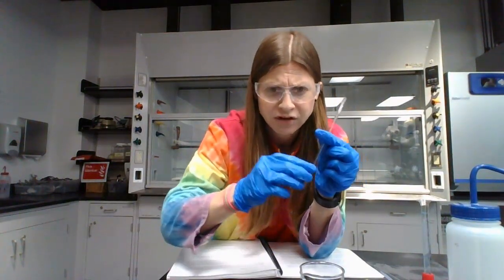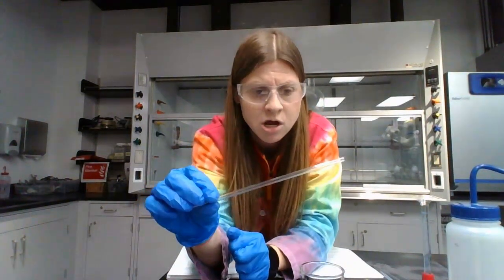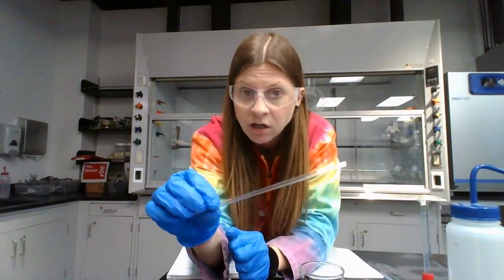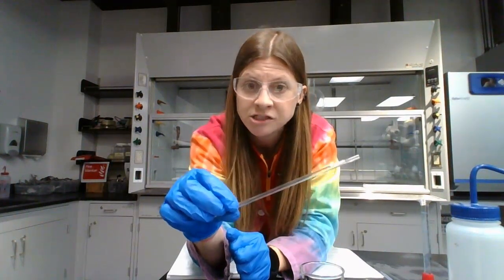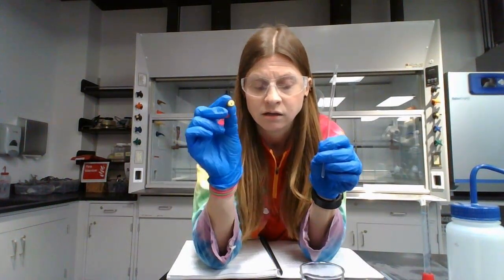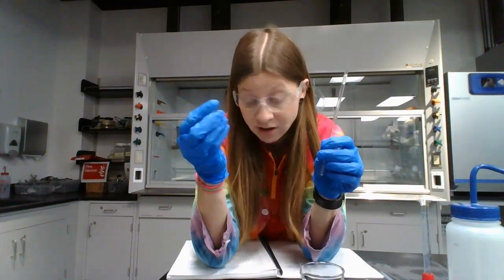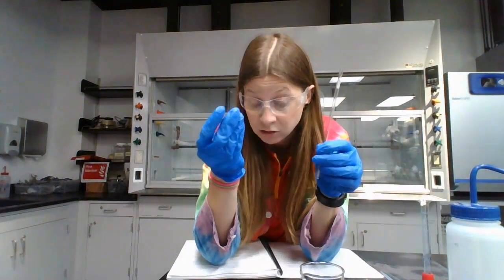So these NMR tubes are very skinny. They have little markings where you can write on them, but I have a really hard time writing something that's legible on these NMR tubes. So you're going to have at least 2 standards, and you're going to need to be able to tell them apart once you put them in the NMR tubes. So my suggestion is to get 2 or 3 different colored lids, and like I would say, yellow lid is for my standard 0.25, and red lid is for my standard 0.75, and make a note of that in my lab notebook, because again, I have a hard time writing on these. Maybe you'll have better luck.